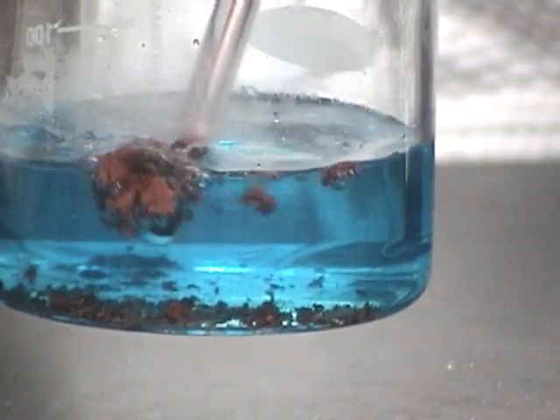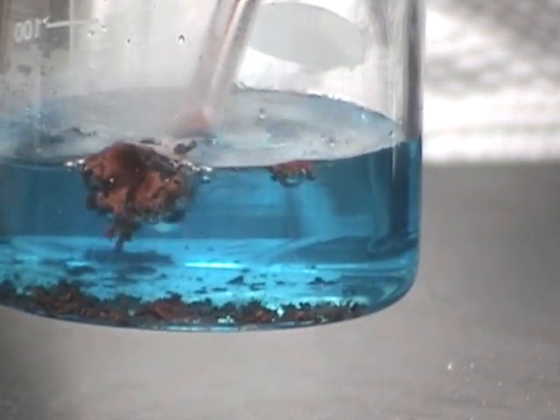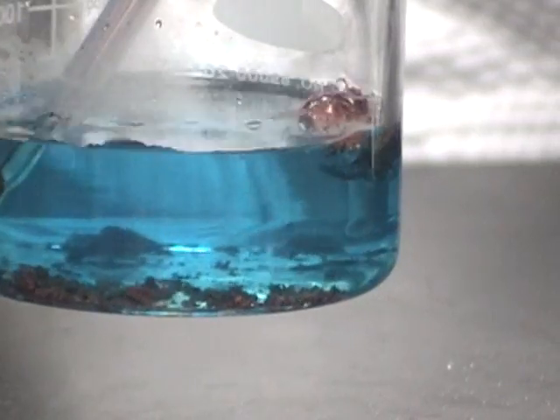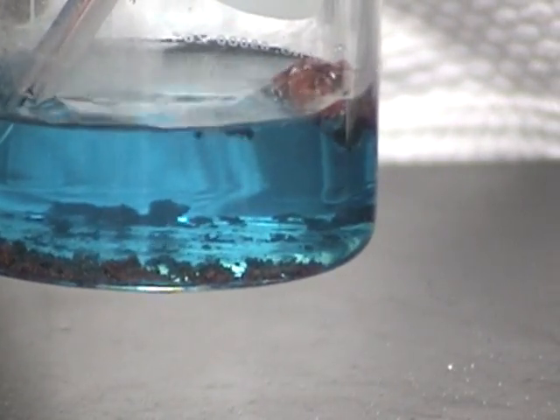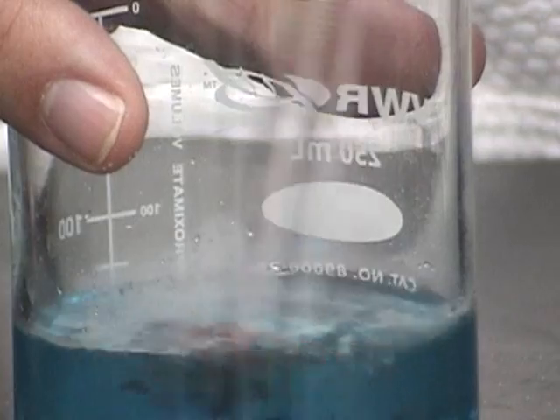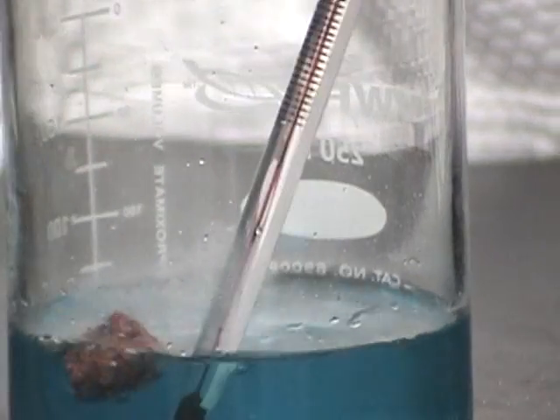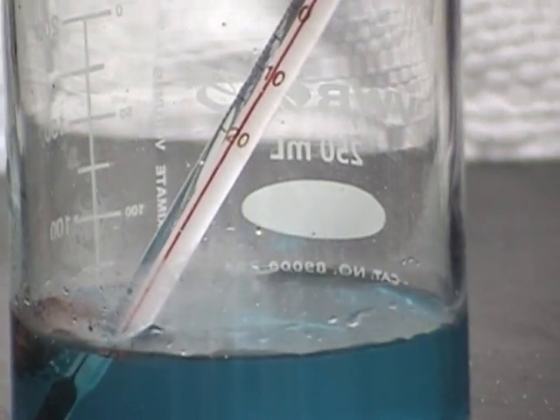And if I keep tapping, just very gently, tapping the aluminum foil, more pieces keep dropping off the sides. Something else that I'm noticing is that this is a slight exothermic reaction. Remember I told you it was about 25 degrees Celsius in the room during my last check. And let's see what our temperature is now.